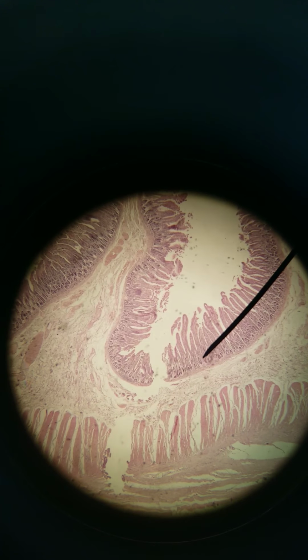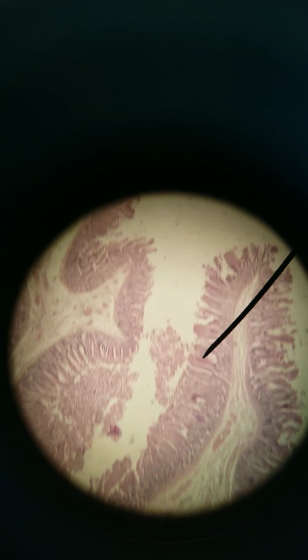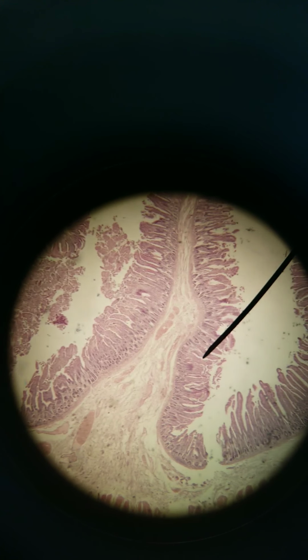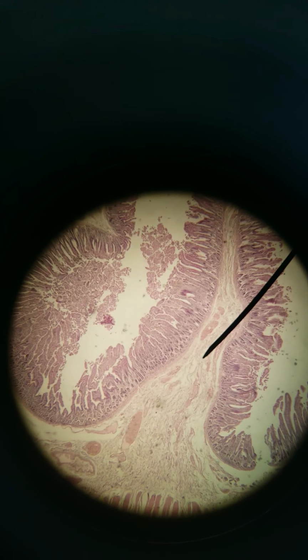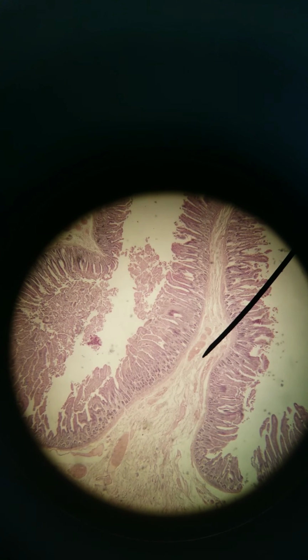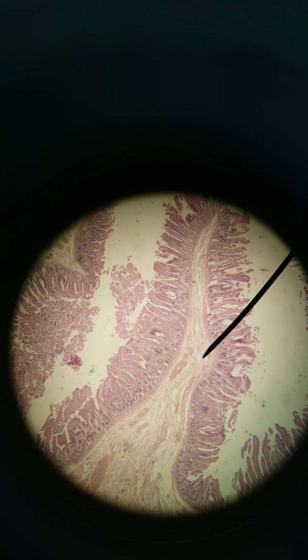But even the mucosal layer makes folds. So this big fold, that's not a villus. That's called a plica. Plica circularis. They're circular ridges. So villi, or let me go in order. Plicae are the big folds that you could see with your own eyes if you looked at the inside of the actual intestines. This is a plica, or plural plicae, P-L-I-C-A-E.